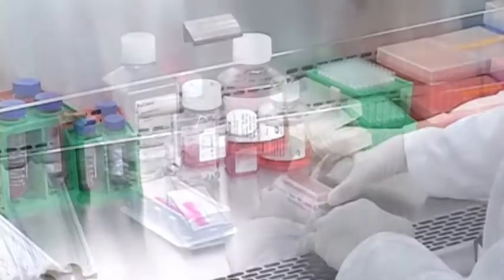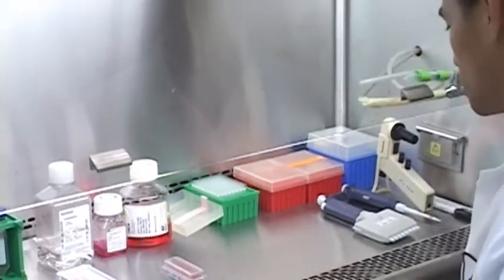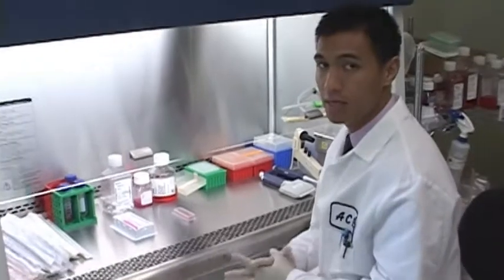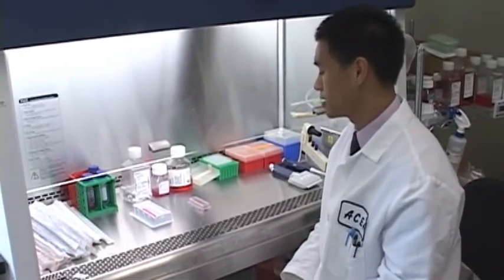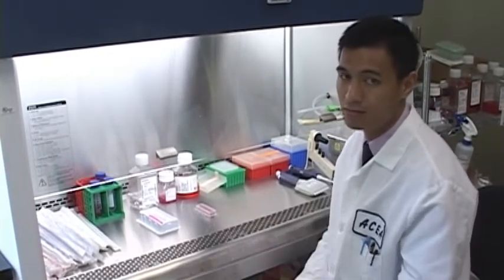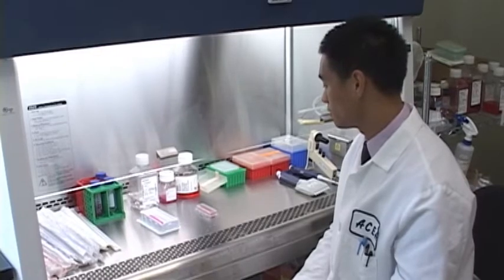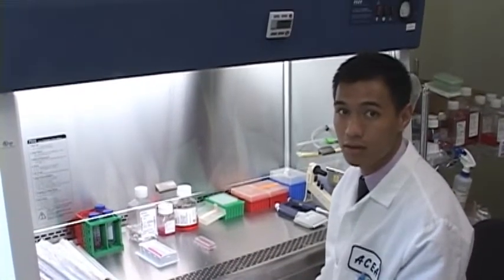And that's it. So in general, we recommend incubating the cells at room temperature just like this underneath the hood for 30 minutes prior to putting it back into the incubator. And this is just to ensure that the cells settle nice and uniform on the bottom of the substrate to prevent any variation in the well itself. And so we'll let that sit for 30 minutes.